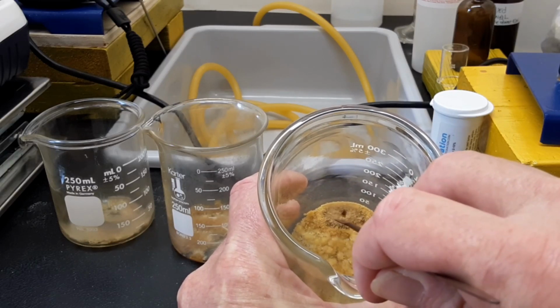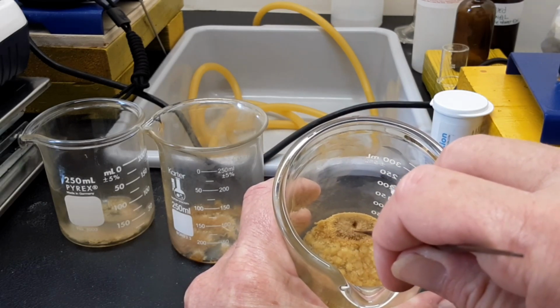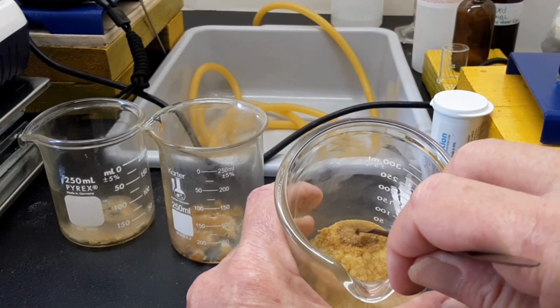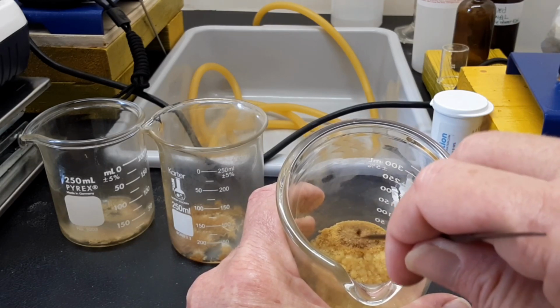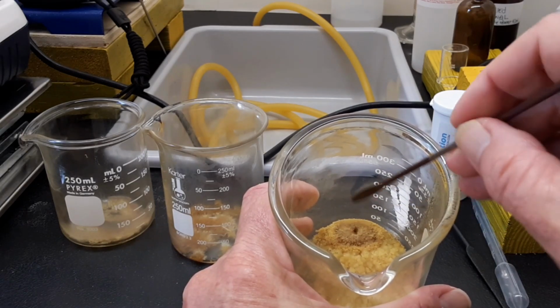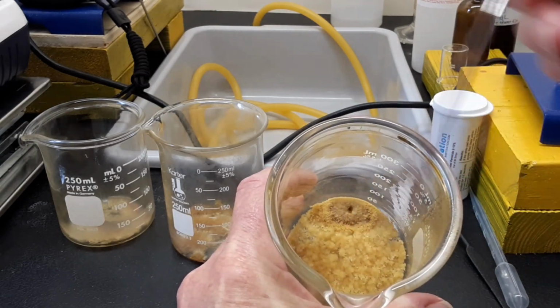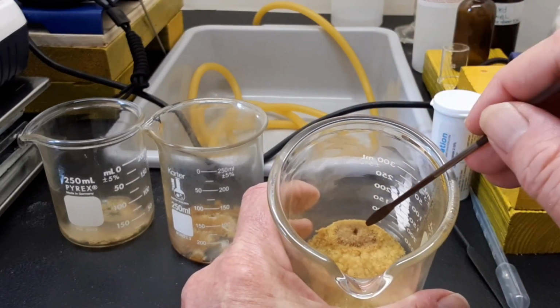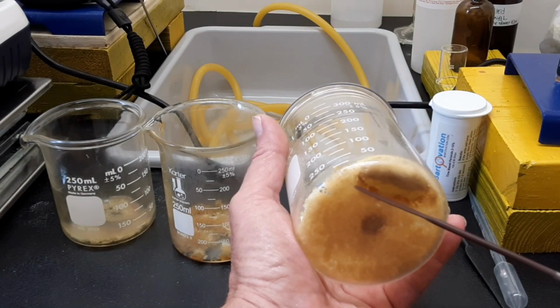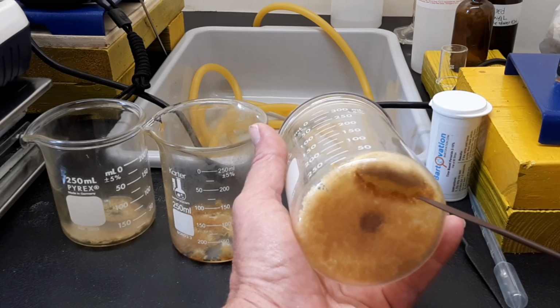I left this set in the sun for about an hour outside, and then I decided I wasn't going to do the video outside, so I brought this in and I thought, what the hell? What happened to this by setting in the sun? Because originally this crater was not there. This was a big plateau on top, if you get what I'm saying. And in the process of being in the sun, it formed a crater, and all this stuff that was plateau fanned out. You can kind of see that it's all pushing in an outward direction away from the center of the volcano. And on the bottom, it's got like a watermark line here. I'll just call it a watermark line because I don't really know what else to call it. That wasn't there prior to going outside with it.